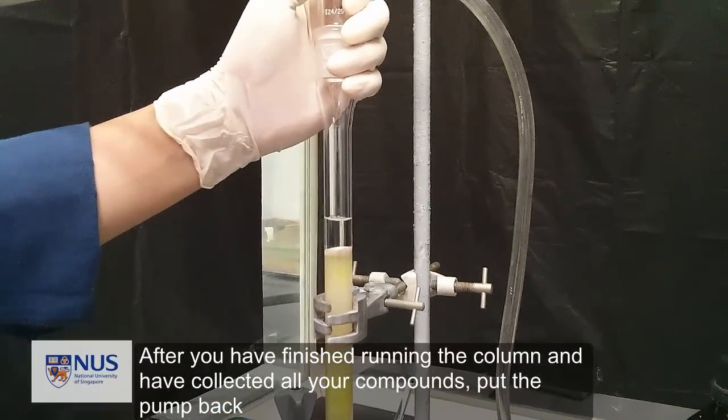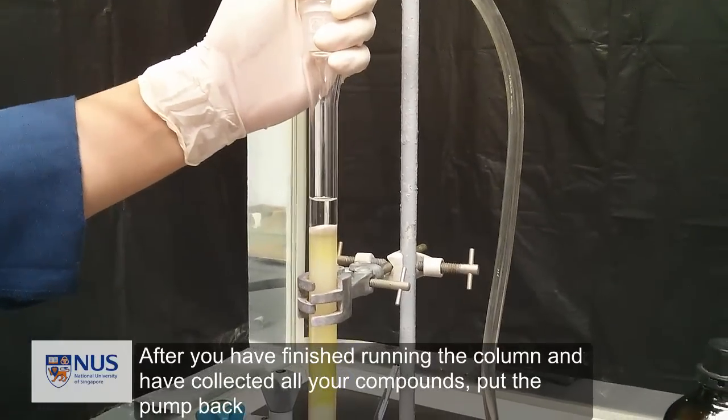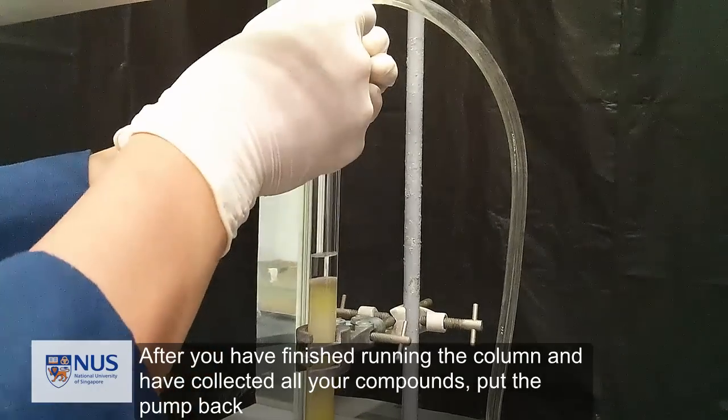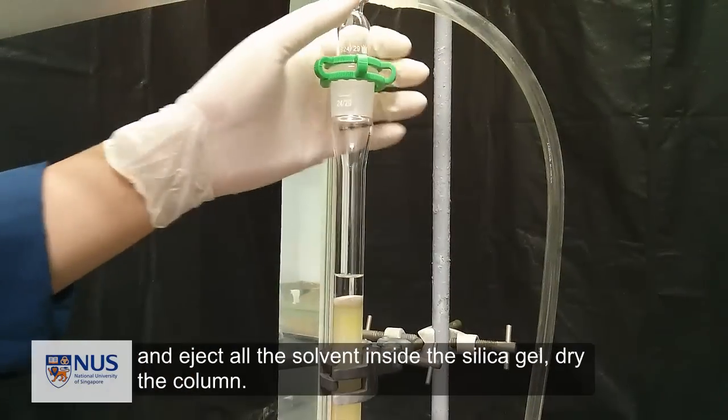After we have finished running the column and have collected all your compounds, put the pump back and eject all the solvent inside the silica gel. Dry the column completely.